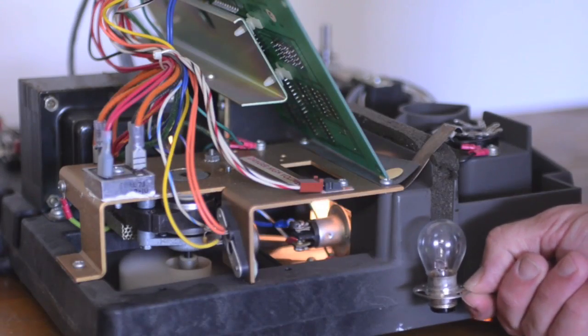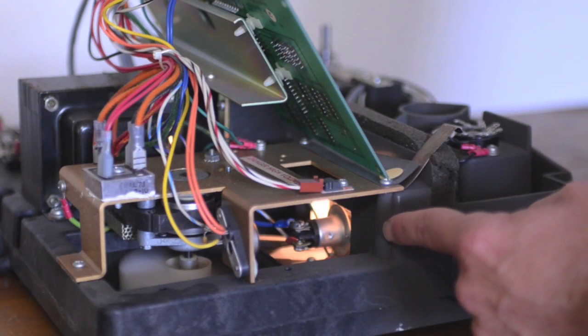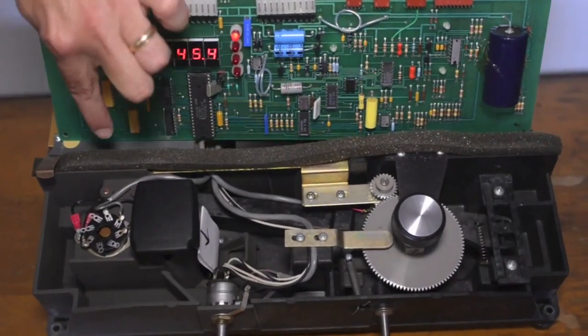Again, the lamp looks like this. In the instrument, it's positioned horizontally, and you should see some light coming out of here and perhaps the back of the lamp. We've rotated the instrument and elevated it to help you see the insides a little bit easier. Just to orient you, the lamp sits right under here.